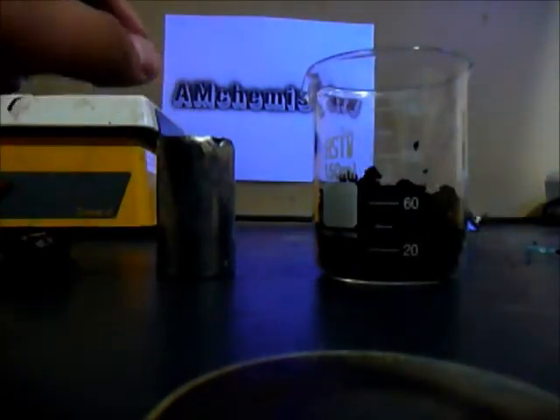So now, just get a scoop, and with the beaker, get everything inside here. Okay. So, I'll be showing you next. So, after taking all the manganese dioxide, this is what I'm left with: manganese dioxide, and this is my zinc metal, and my carbon electrode.